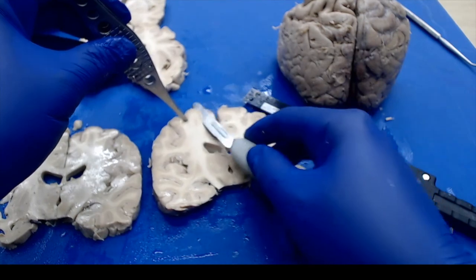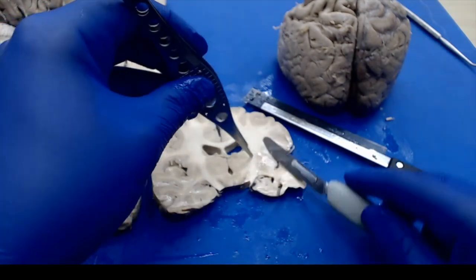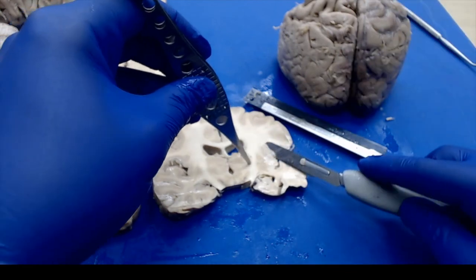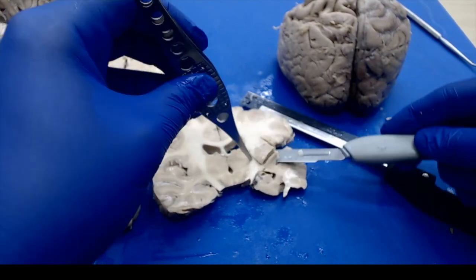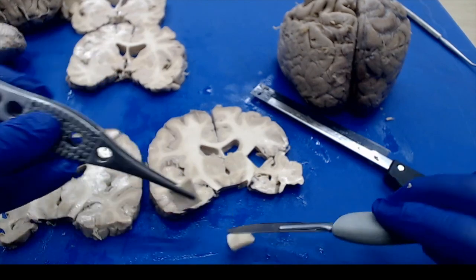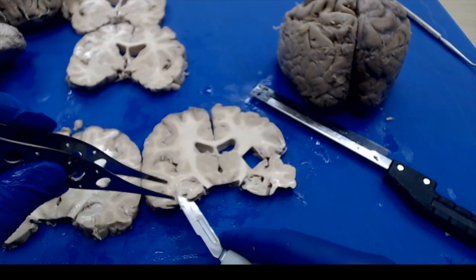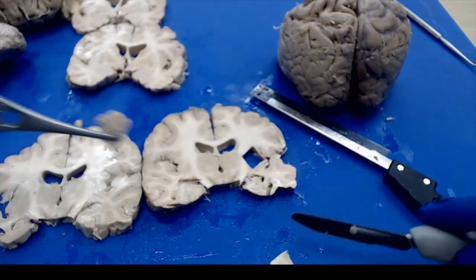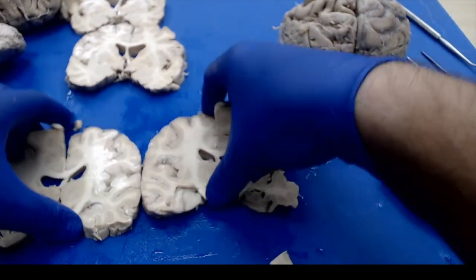So we'll get some of our cerebrum. I'll get some of my basal ganglia here. And I'll just go ahead and cut that whole square out and then just make it a little more manageable to determine any infarcts or movement disorders. And then finally, I'll get a little bit of my hippocampus. Remember, going for that little curly Q, cinnamon roll appearing structure there. Okay, so if you're keeping track, we've already gotten 4 of our 5 basic structures.